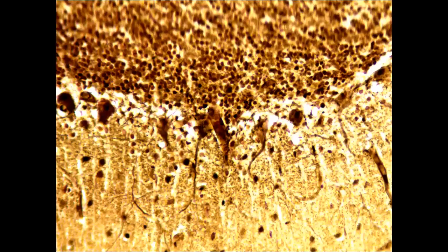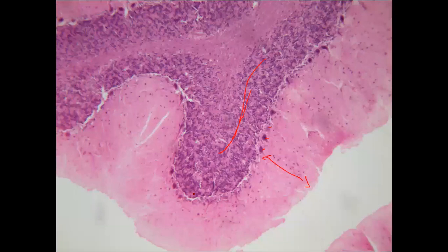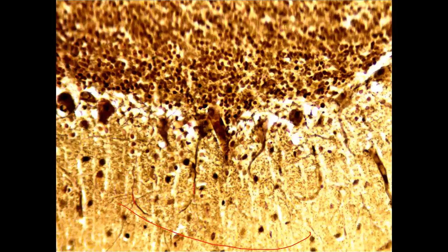And then this is a specialized stain, a picture I took, clearly demarcated. That's a super magnified picture of the stain. This is a silver stain, by the way. This is the molecular layer. You can see the fibers here. This is a specialized type of stain that we use to enhance the fibers as well. Because in the previous slide, you can clearly see the cell bodies and the nuclei, but you cannot see the fibers. But in this, you can clearly see the fibers.